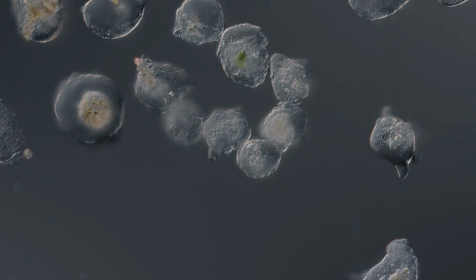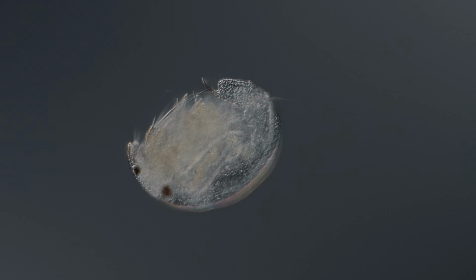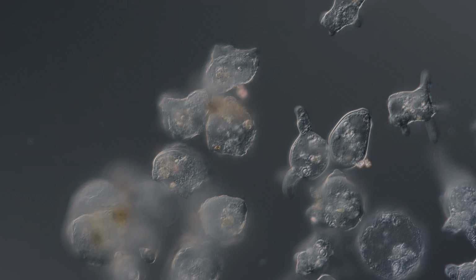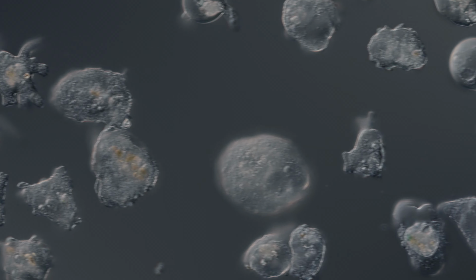Let's see what else we get. Here is a very fine example of a cyst candidate. Okay, what else we got here? Now you can see the floating state. Here's a definitely eating one, going for food. I want to do a Thecas experiment tomorrow, to put some food on a far edge and see if they're going for it.